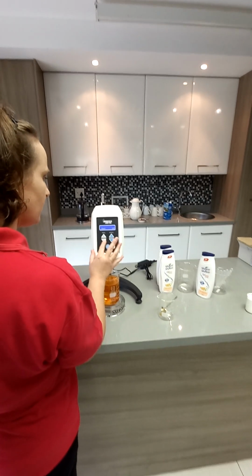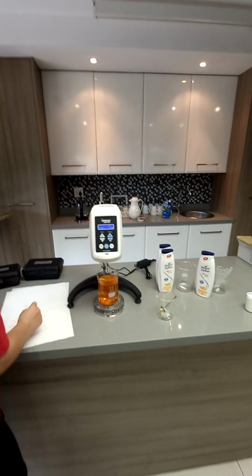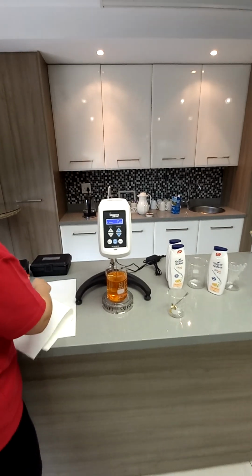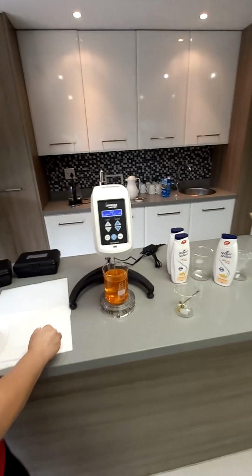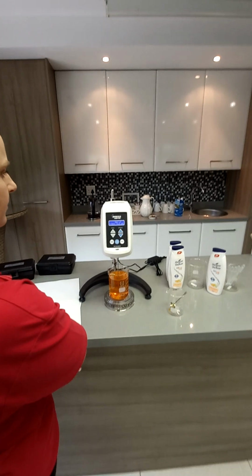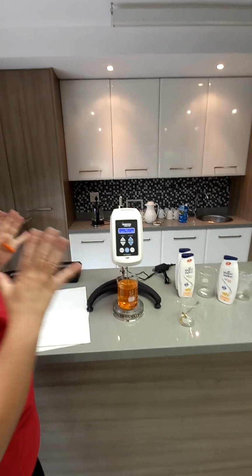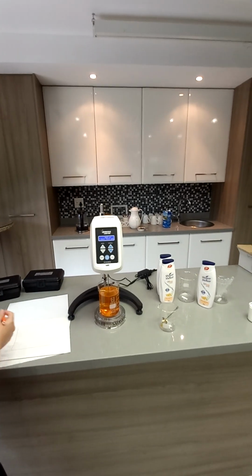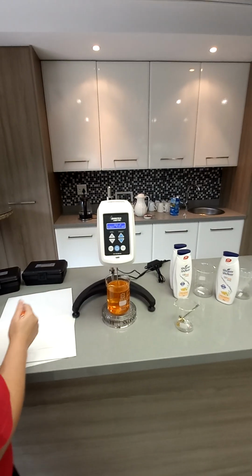Okay, so now that's spindle 5. I'm going to start again at a slow speed and see what happens. Scrap this one. Did you actually tell the machine it was a spindle, or it picks it up automatically? No, you have to tell it that it's that size spindle. See, now you've got a completely different value, because of that formula. It all depends on what sample and what speed you use. Viscosity is not just a one value thing. It depends on different factors.